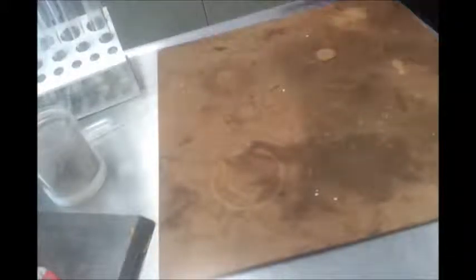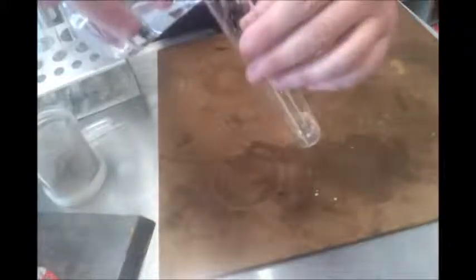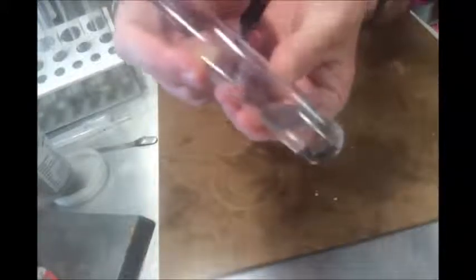So the first one we're going to do is a really simple one, and it's just where I'm going to have some sulfuric acid and my boiling tube here, and I'm going to add some iron powder to it. Now I'm going to heat this up a little bit just with my hands, because it doesn't always start straight away. And we can start to see a few bubbles forming on the surface. So I'm just going to leave that for a wee while.